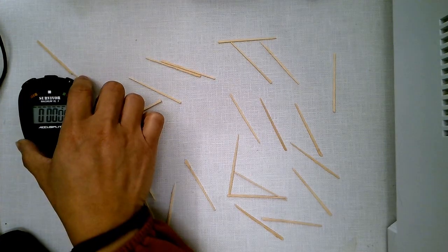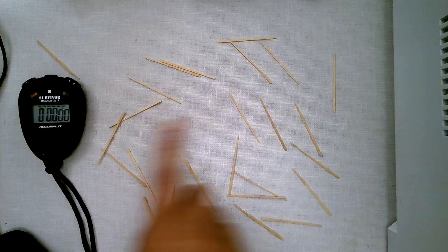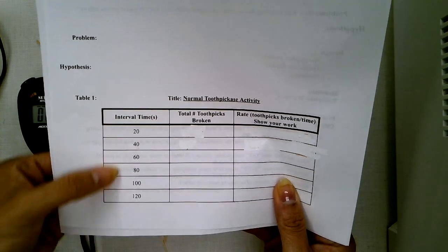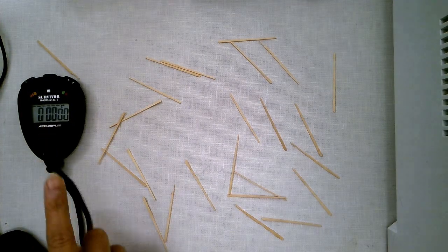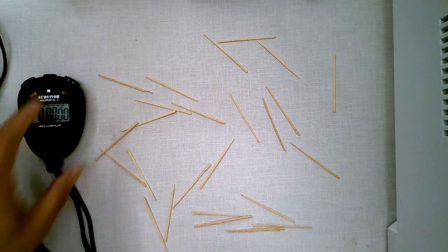I'm going to start the video, and you're going to go ahead. I'm going to keep playing the timer, and you have to pause every 20 seconds, so whenever you hit these points, remember this is counted as seconds, okay? And in this case, it'll go into seconds and minutes, so be careful with that. Alright, so let's take a look. I'm going to start the time.